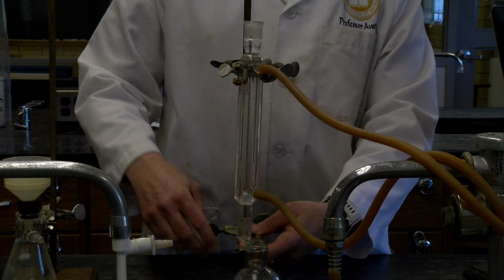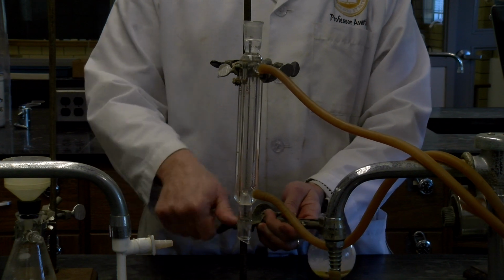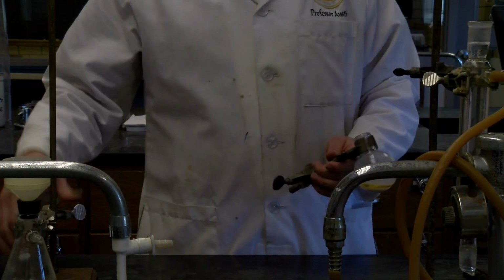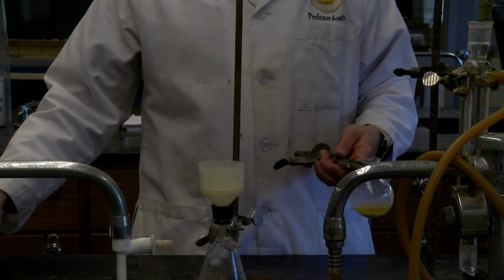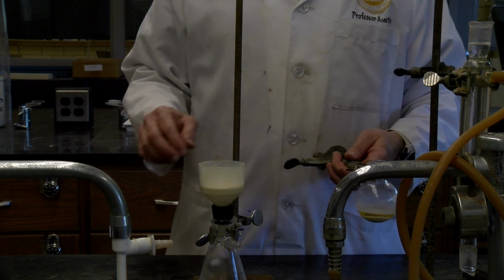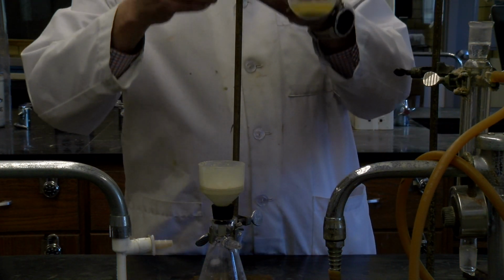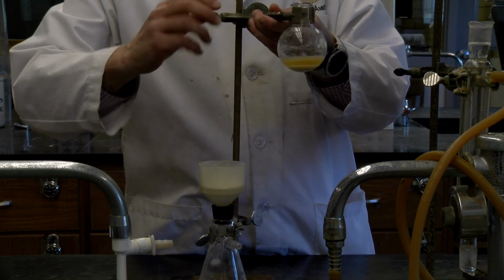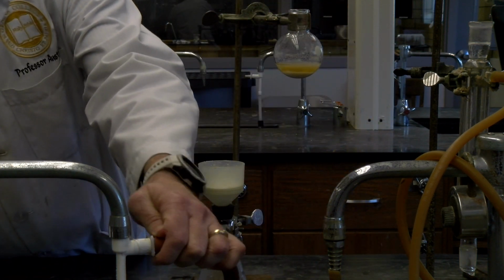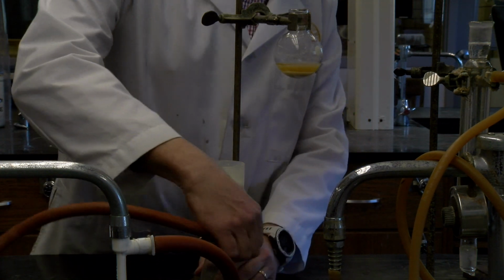So I can come off. Oh, there we go. Push that off to the side, and of course then what I want to do is bring in my filtration apparatus. I've got a piece of filter paper. Once again, I'm not going to weigh the filter paper. I'm going to actually use a watch glass since we're going to heat it in the oven. We're going to filter this, so set this up.